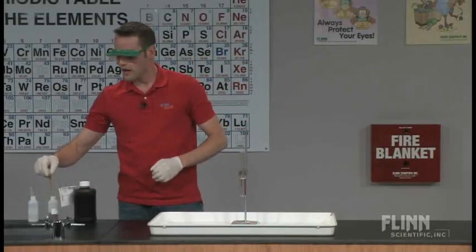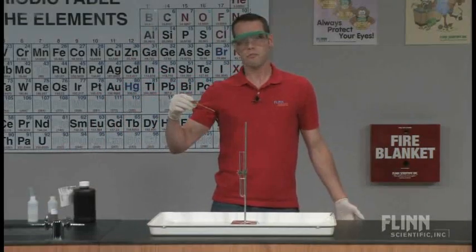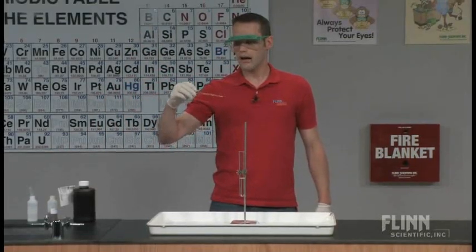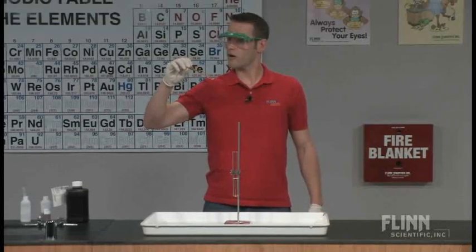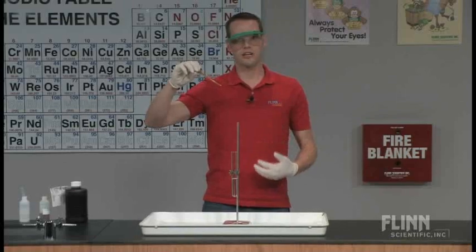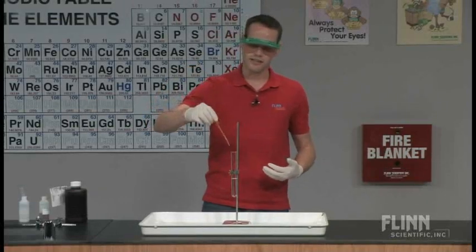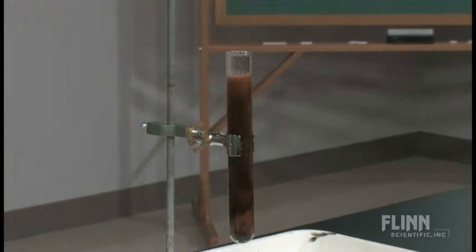So I'm going to add a catalyst. The catalyst I'm going to add to this is iron chloride. This is a 0.1 molar solution. Iron chloride does give you a nice yellow color. I do show my students the color before I start the demonstration. And then they can see a very clear color change as soon as this contacts the hydrogen peroxide solution. So if I squirt some of this in, you can see right away you get that dark brown color.